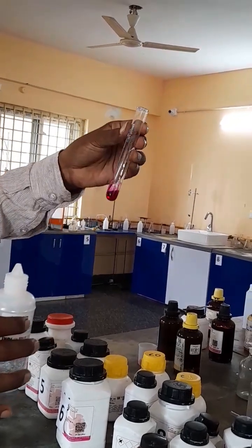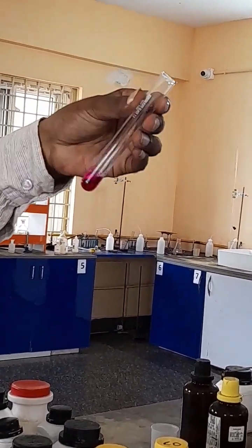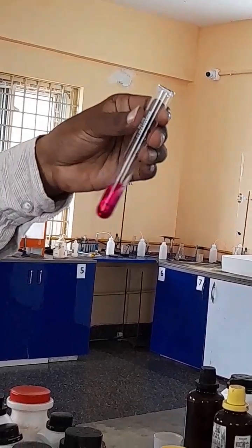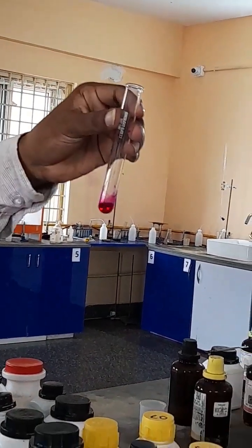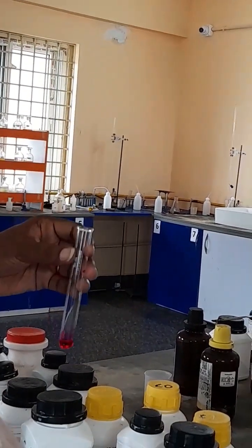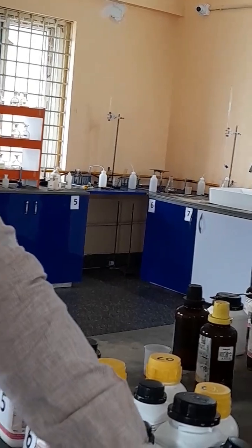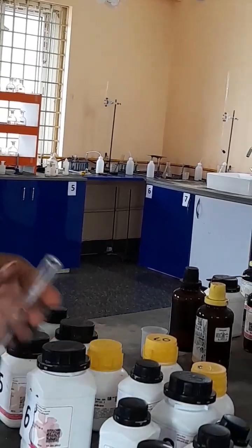You can see it has developed a pink color — it started as a light pink but now it has become a little more intense. Similarly, I have taken one more test tube here.